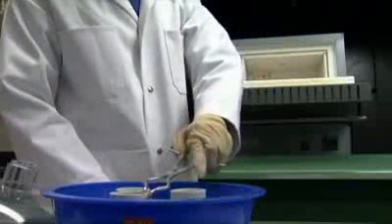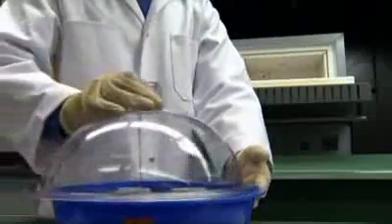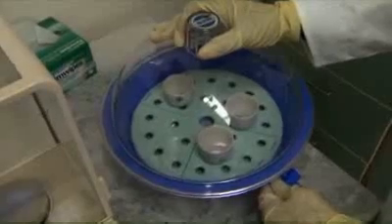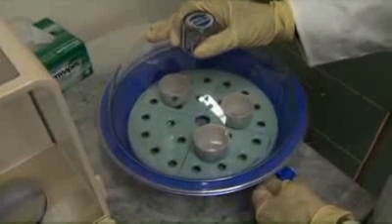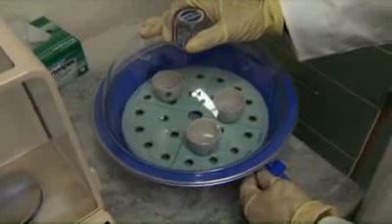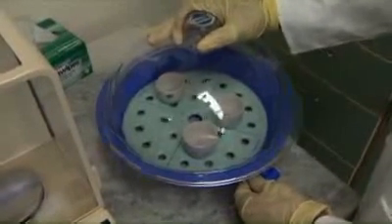Because cooling of the furnace will take several hours, it may be more practical to leave samples ashing overnight. Allow the samples to reach room temperature by leaving them in the desiccator for a minimum of 30 minutes. Release the desiccator vacuum very, very slowly and carefully. Releasing the vacuum too quickly will disrupt the contents of the crucibles, and ash may be lost, thus resulting in inaccurate %ash results.